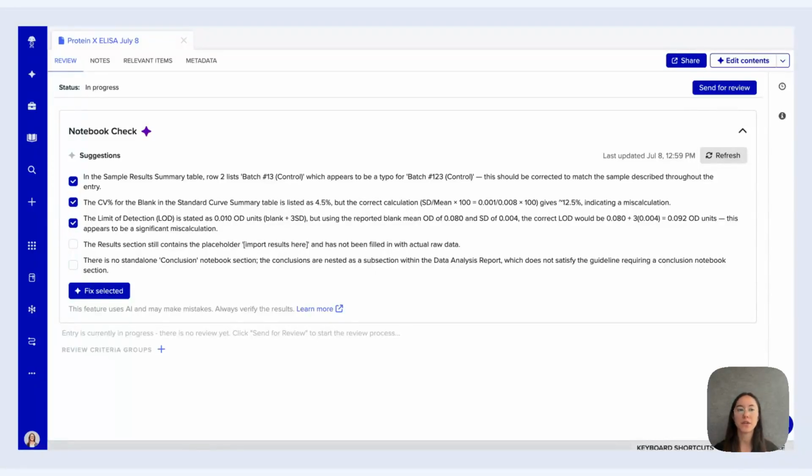In my case, I see in the Notebook Check suggestions here that there are some recommendations for potential issues or errors with my entry where I've listed the incorrect batch number, which is indicated by this first item here, as well as a miscalculation for the %CV, as well as a miscalculation for the limit of detection that is noted in my entry. Let's go ahead and compare these side by side with my entries so I can just quickly confirm that these are in fact suggestions that I want to apply before we talk about how you can apply them.